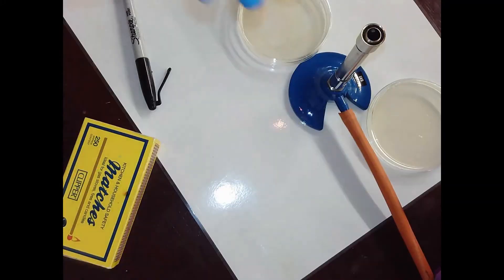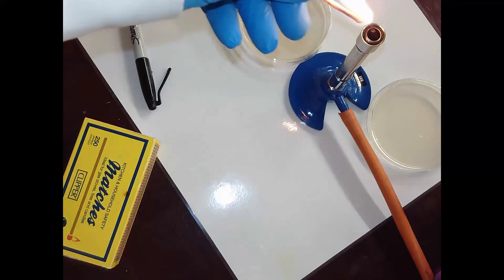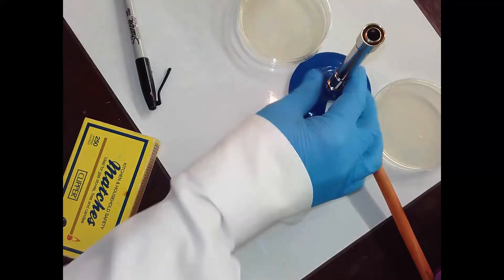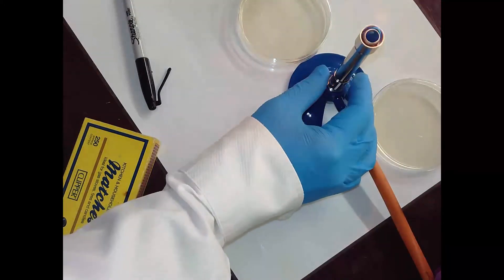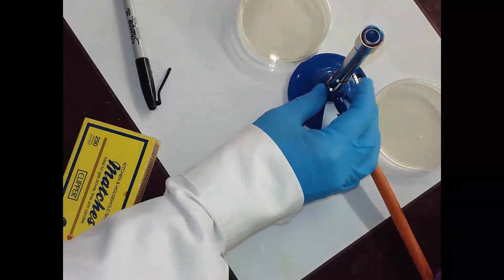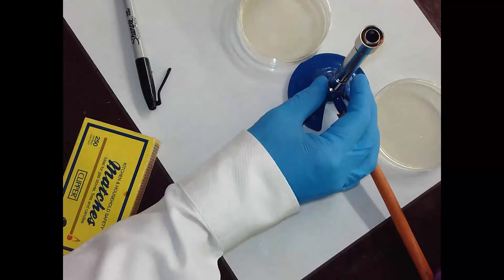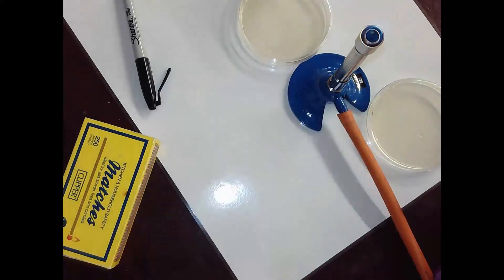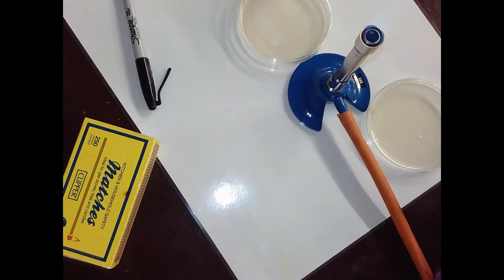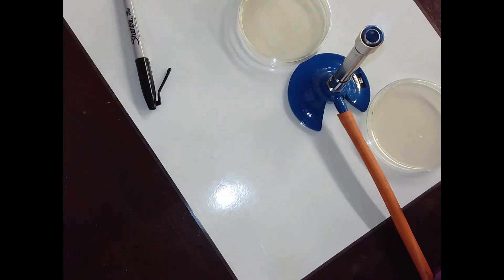I'm going to turn on the gas. It's not very good gas, there we go. Just give it a moment to sort itself out. I don't think it's been lit for about six months. So there's my Bunsen burner. Can anyone think why I would use a Bunsen burner? What's the purpose? Does it kill any other bacteria that are around? Brilliant.